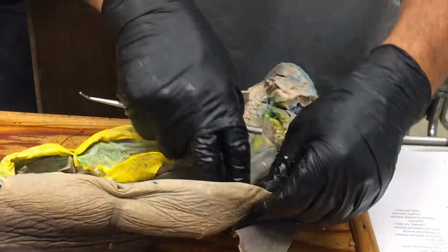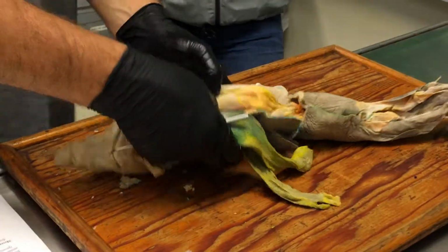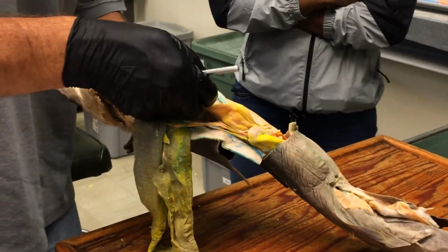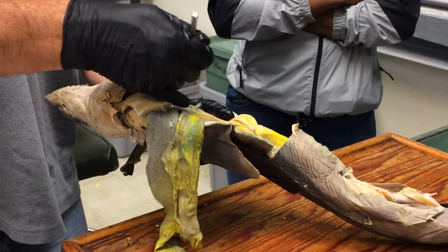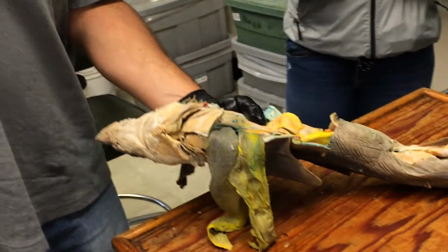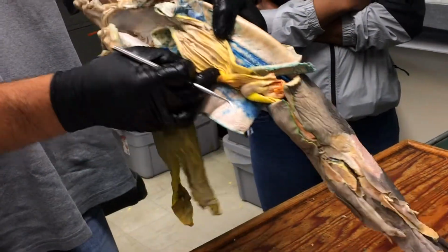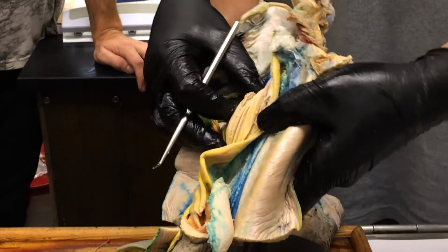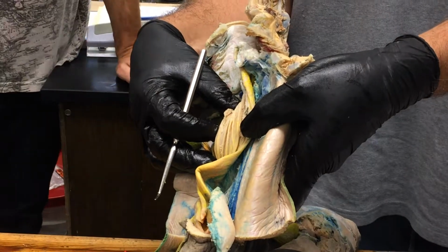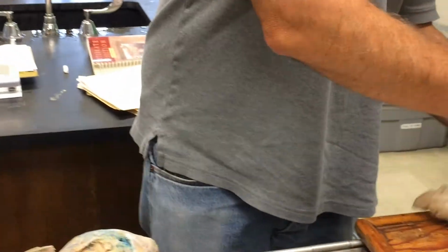The stomach itself is going to be easier to see on this one. So here's the stomach, and it's been cut open. We'll put it back together again for the moment. The stomach has rugae. It has these long folds on the inside, and those are called the rugae of the stomach. You can see the boundary between the stomach and esophagus there, where the rugae stop and the papillae start. Can you see that at all from way back there? All right, see that? Okay. So that's the stomach with its rugae.